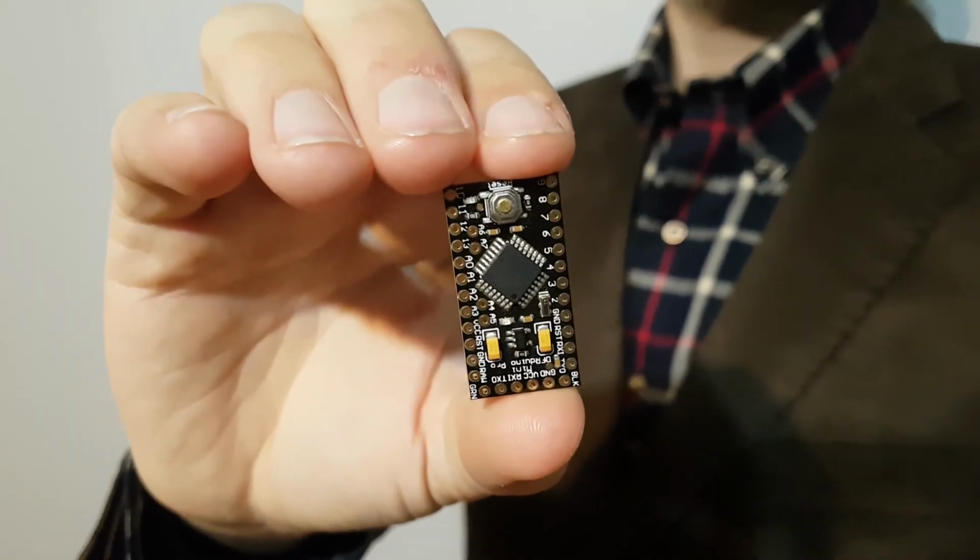Hey guys, my name is Michael Spano, and I'm interested in the interface between electronics and chemistry. Let me tell you a little bit about the flow chemistry apparatus I built around open source microcontrollers and using a 3D printer. I built this system to study the competition that happens between the Clarke-Eschweiler and Pictet-Spengler reactions. I'm interested in automating the task of probing for optimal reaction conditions.